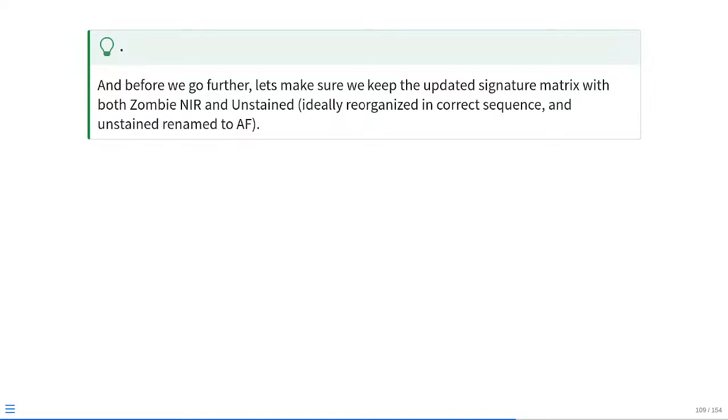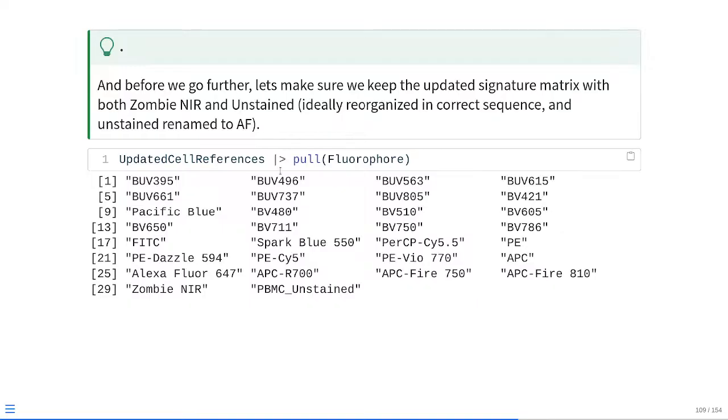So if we don't want Zombie NIR tacked down at the very bottom after APC Fire 810, if we want it in the correct location based on laser and peak emission, we're going to need to rearrange this data frame before we move farther. So let's do a little bit of data tidying just to make sure it's cleaned up. So once again, let's just check. If we take our existing data frame and pull the fluorophores, you can see our current problem.